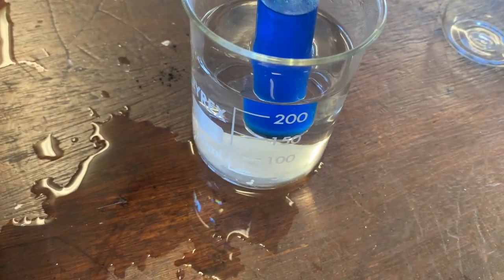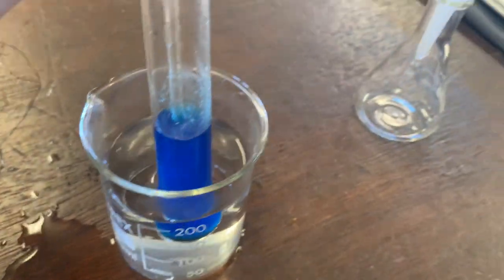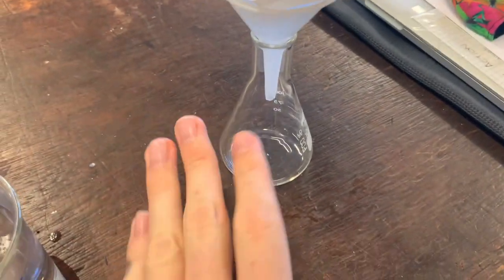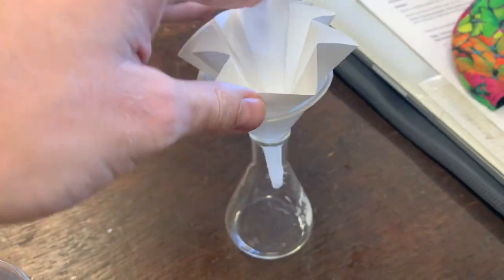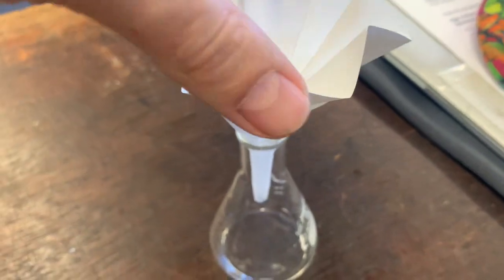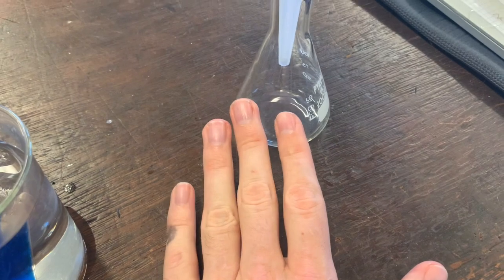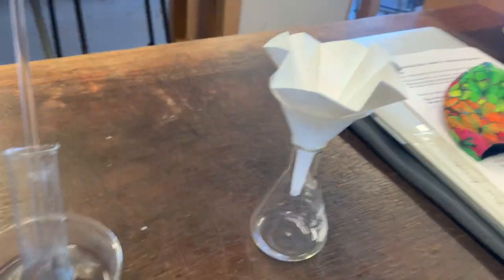We've got a really nice concentrated solution here. So what I'm going to do is put it through a conical flask with a funnel in — and this is a filter paper. Filter paper will separate anything that's solid, so all this black stuff in the bottom will just stay on top, and I can collect the nice blue filtrate that I want to use for my experiment. Let's go and do that now.